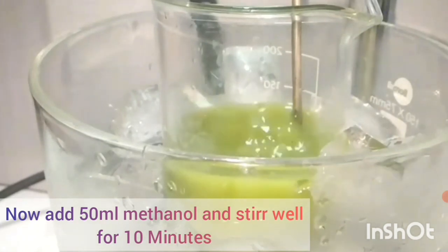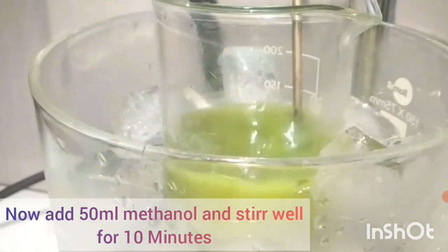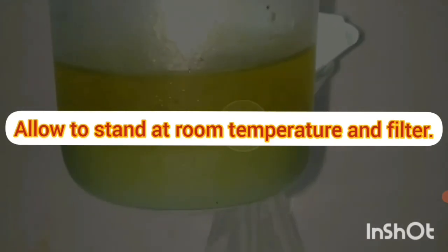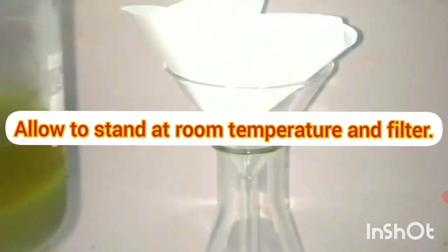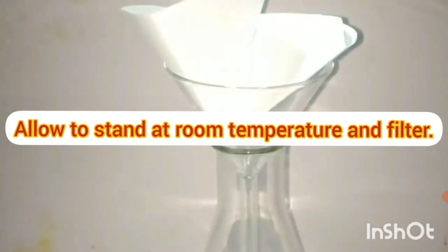After stirring for 10 minutes, stop the stirring and allow the reaction mixture to stand. Then filter the reaction mixture.